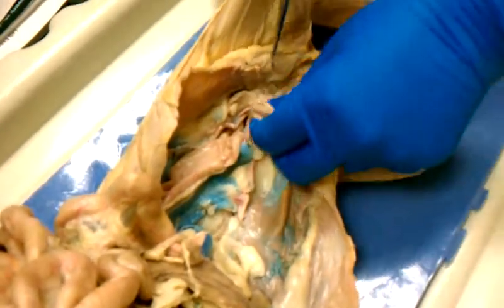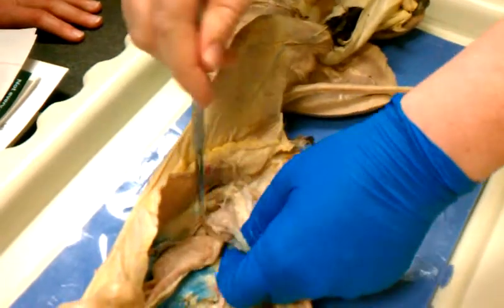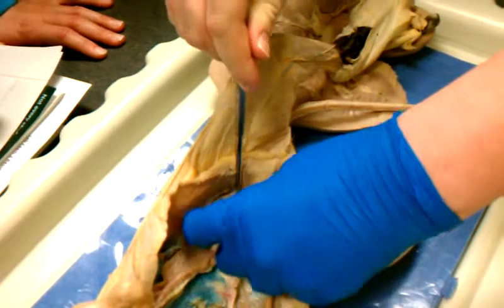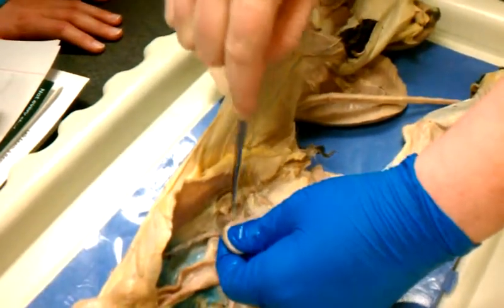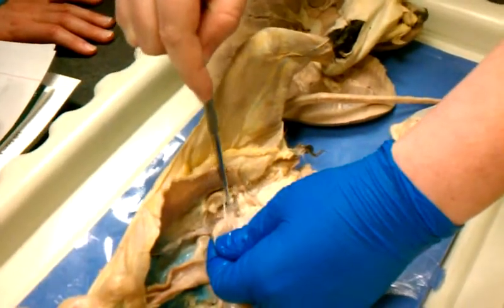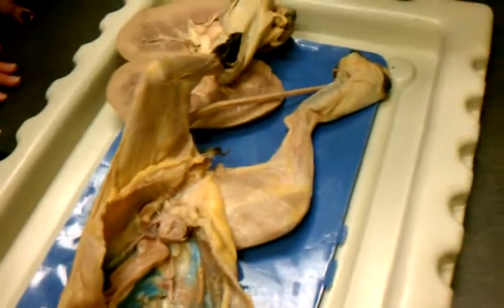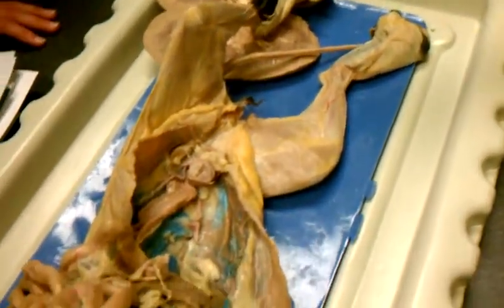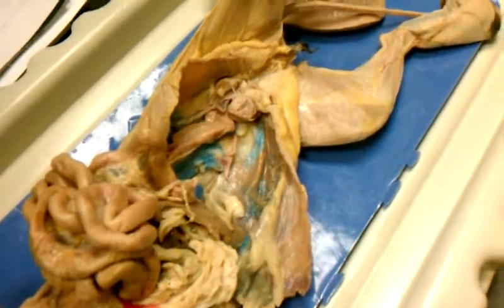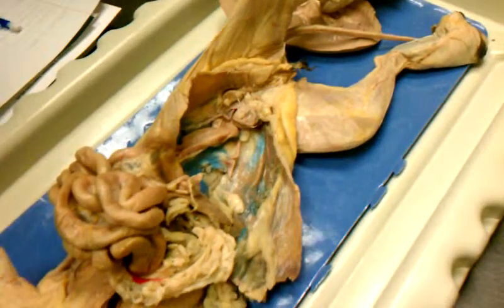And then the tube that leads from the urinary bladder to the outside of the body. I really should have brought a scalpel. It's right down here. This is going to be the urethra, right? So be careful not to confuse, lots of U words, urethra and ureter, right? Ureter connects the kidneys to the bladder. Urethra is the tube that discharges urine from the bladder to the outside of the body.